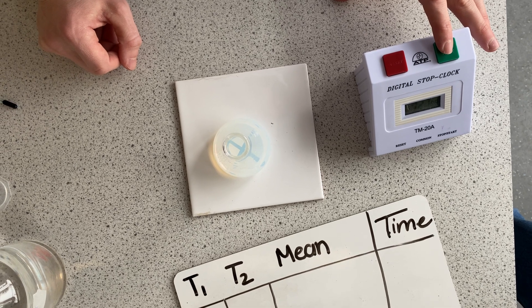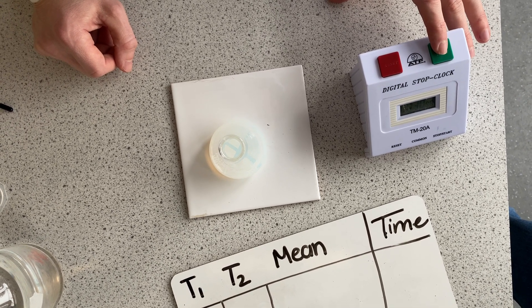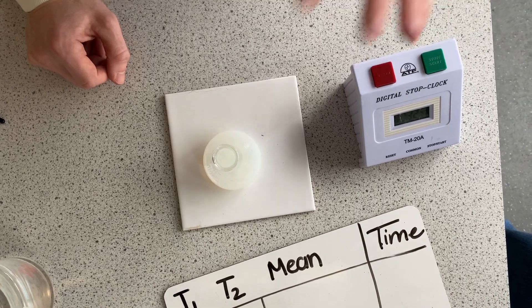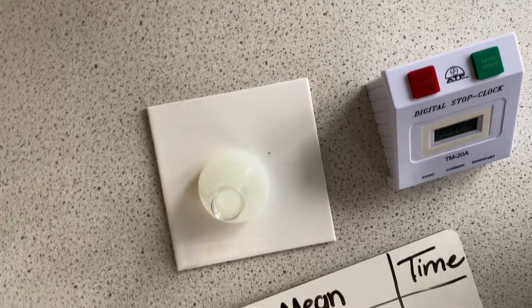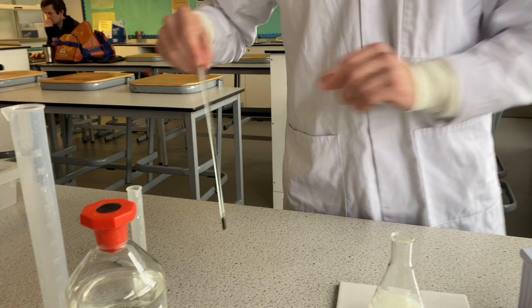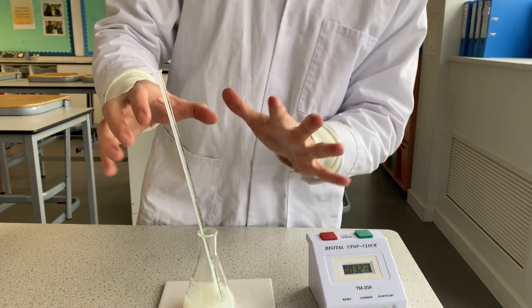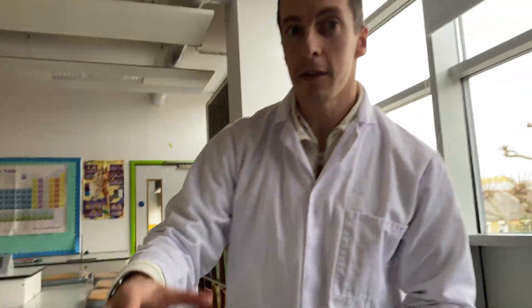You can see the cross is starting to become faint, disappearing. That's the point at which I can no longer see it. The solid is being produced and I now can't see the cross. Now that the reaction has finished, I'm going to record the temperature a second time to get the mean temperature of the reaction.